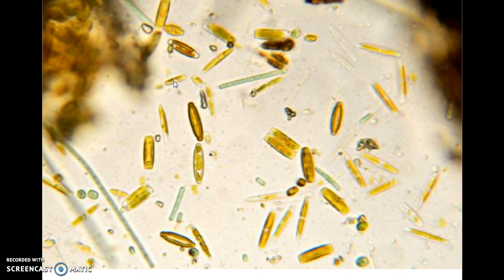So here's our last slide of the day. These are the shells of protists. So you're looking at kind of like the hard shell of some marine protists. These would live in the water, and they'd be near the surface of the water and collect sunlight and actually do photosynthesis, even though they're not a plant, which is kind of a strange concept. They do photosynthesis, but they're a protist, a single-celled organism with a fully developed nucleus.